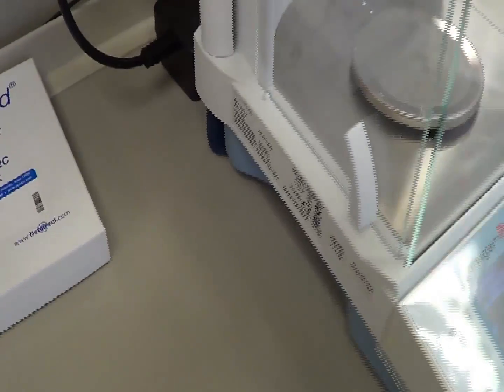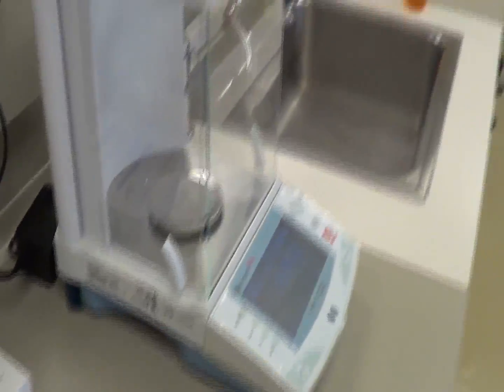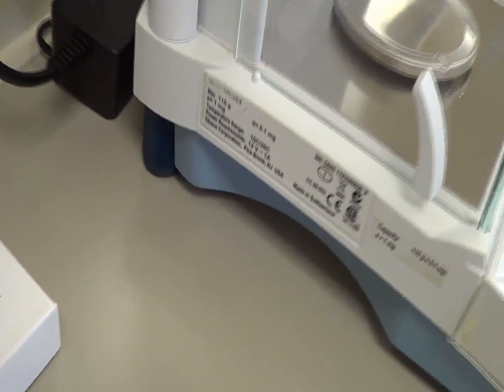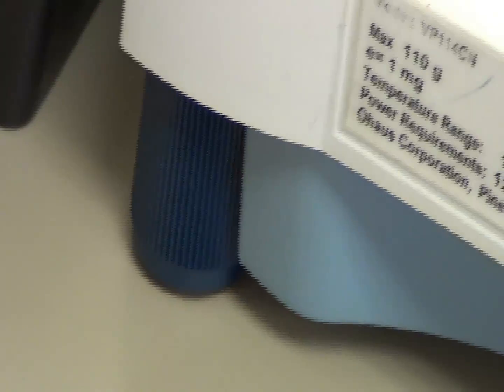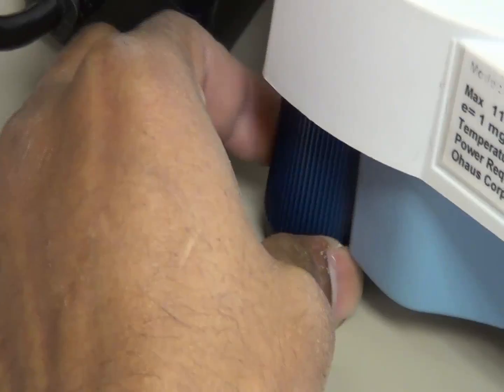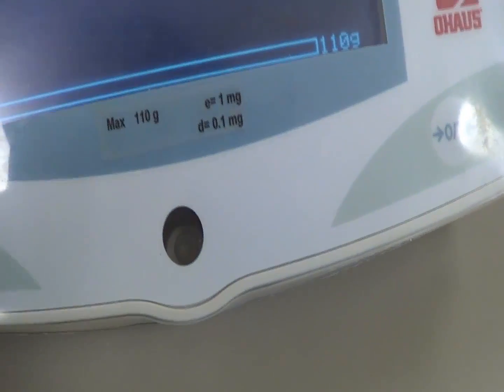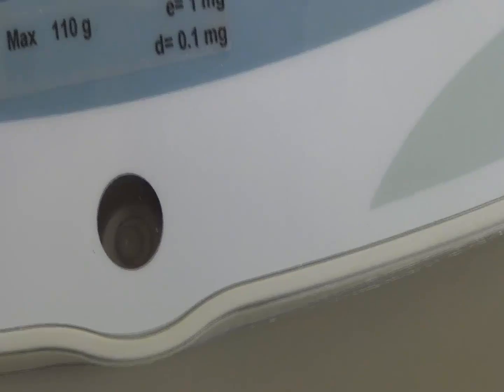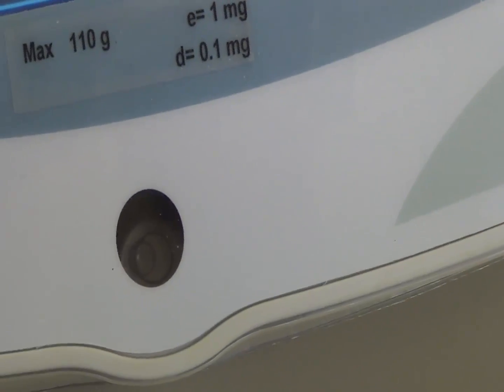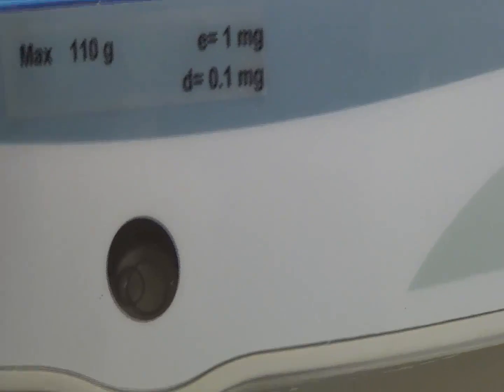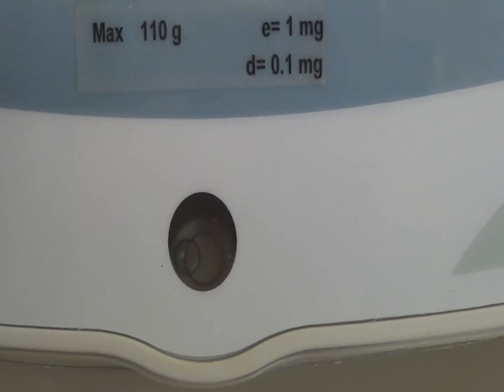So how do you adjust the weighing balance? Can you see the base? This base you can rotate, you can move either clockwise or anticlockwise direction. So when you are moving this base, let me show you clearly here. I am now rotating this clockwise and anticlockwise. Can you see that? The bubble is deviating from the middle. That means it is not properly set up.